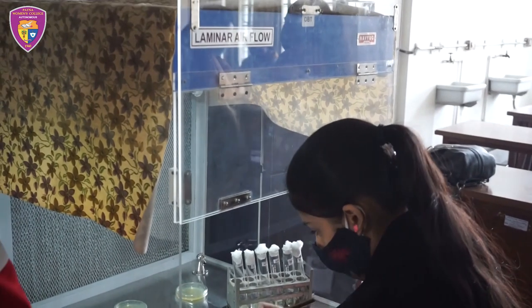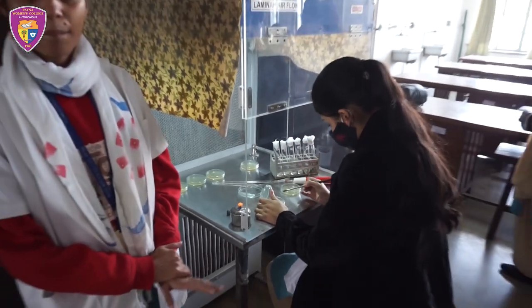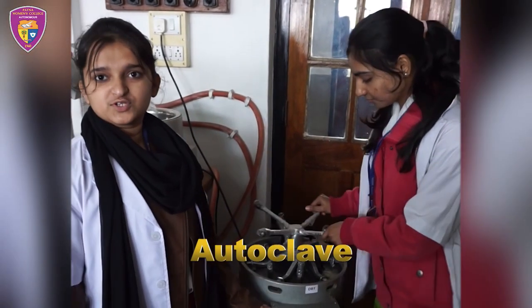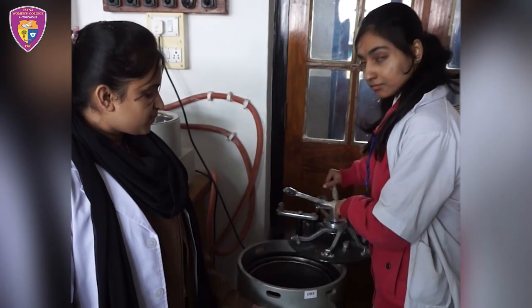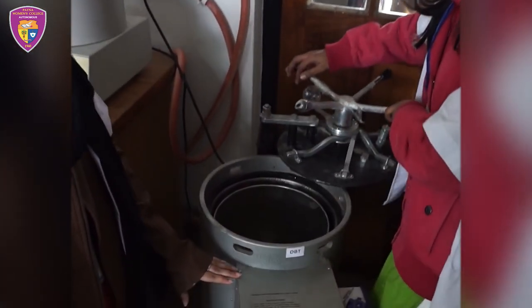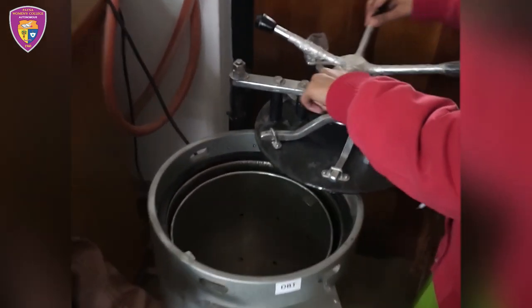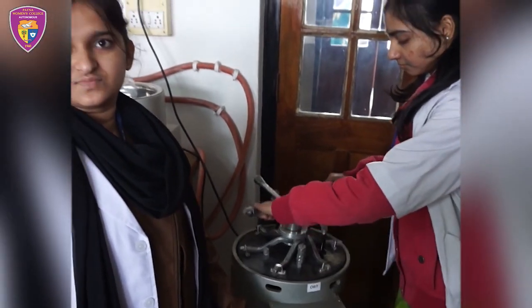Here she is demonstrating the spreading of bacterial culture media by serial dilution method. The autoclave works on the principle of sterilization. It is used for 15 minutes at 121 degrees Celsius and 15 lbs pressure to destroy microorganisms.